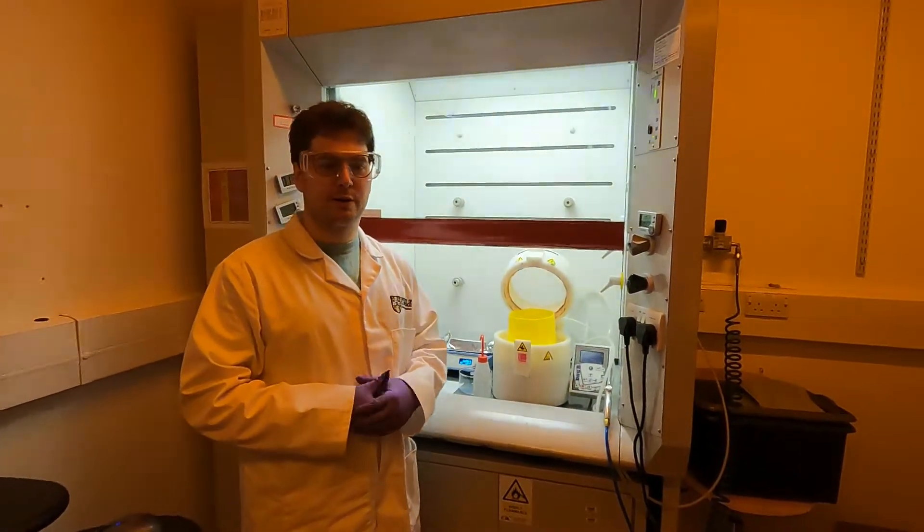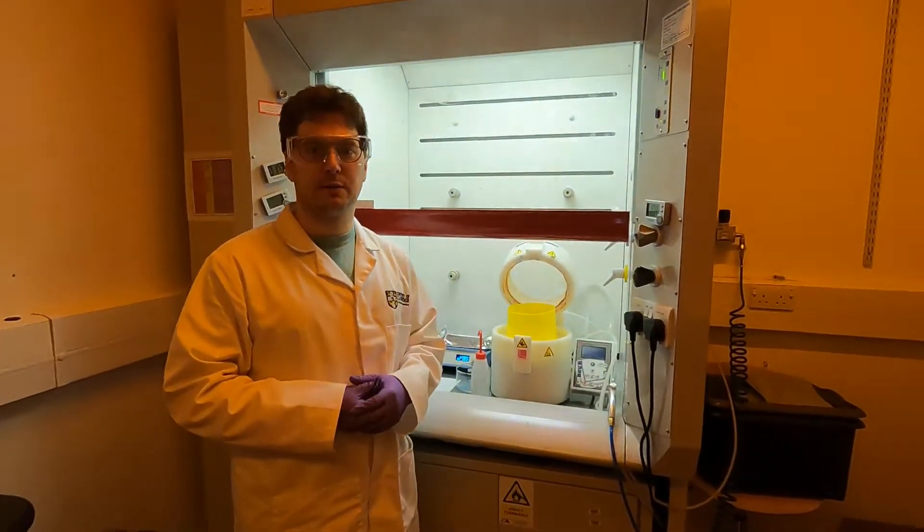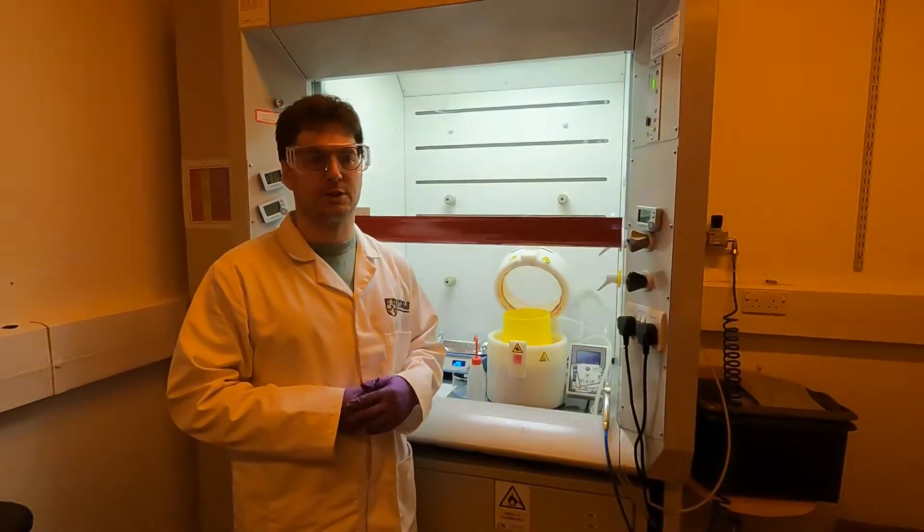Hello everyone, this is a quick tutorial about how to spin coat SU8 and prepare it for the fabrication of microfluidic channels.